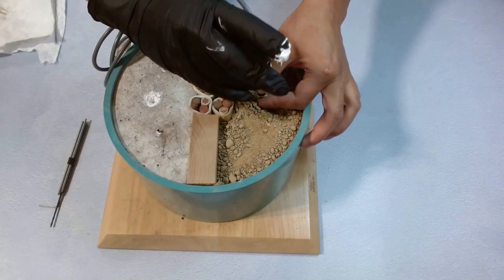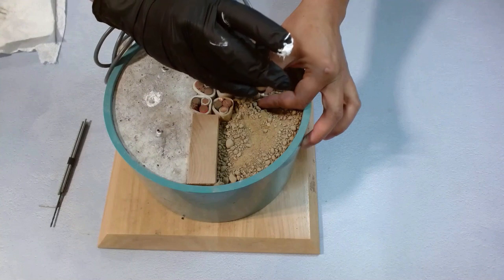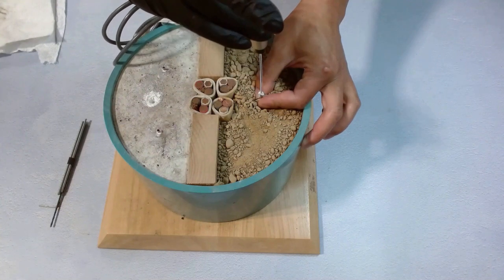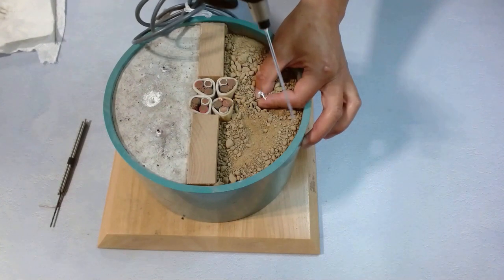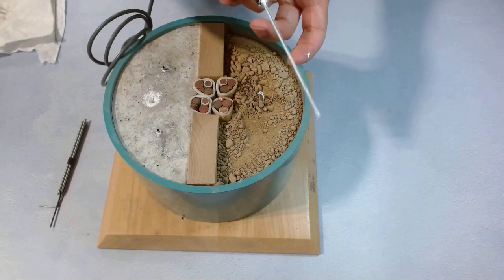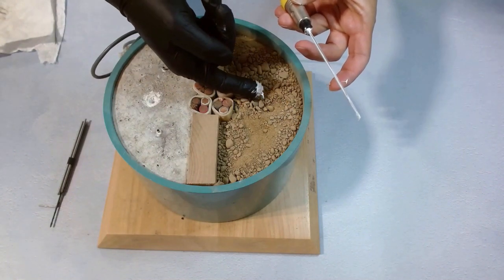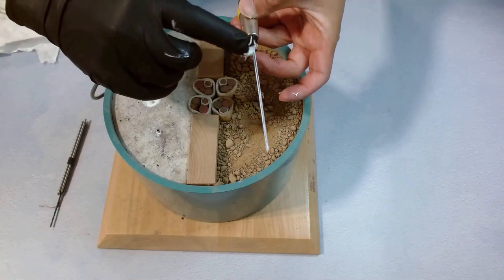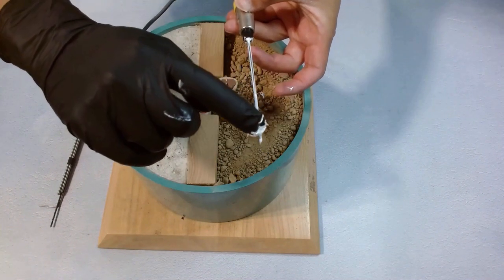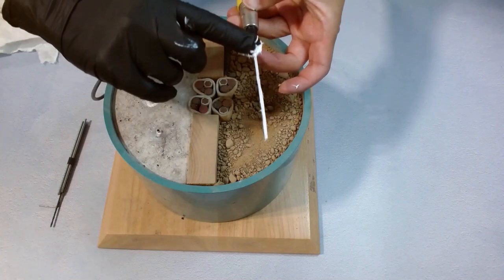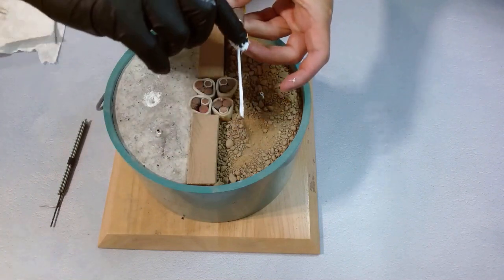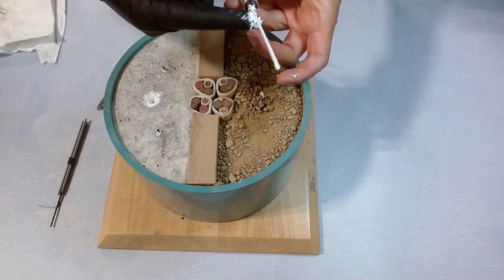This is a little loose, so we need to hold the sleeve and push, then pull the TLS out to make sure the needle is still covered with paste entirely. A part of the needle tube got the thermal paste scratched off. We can see this shiny part. We cover some thermal paste back.